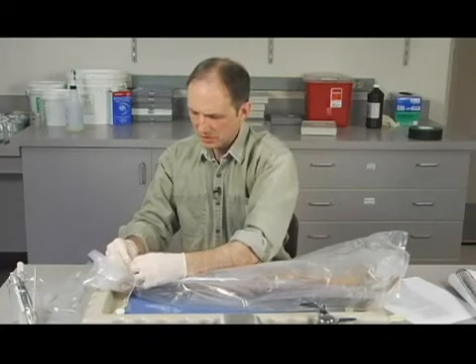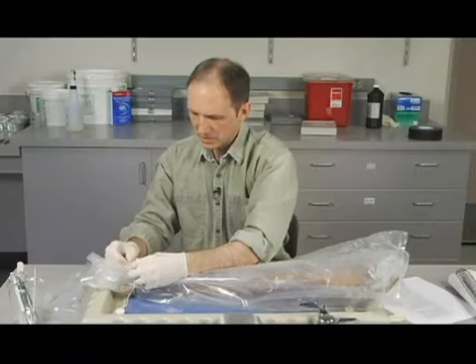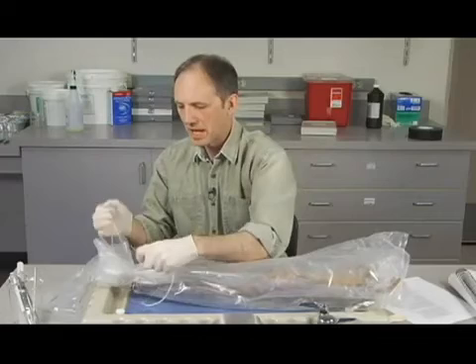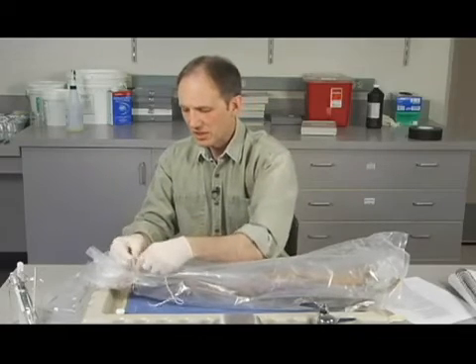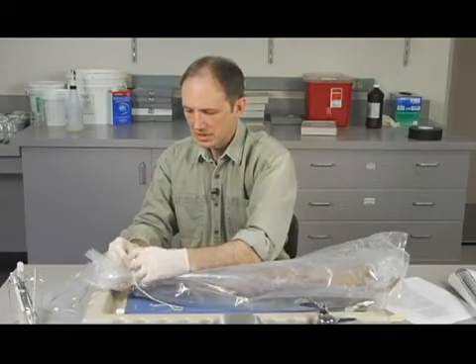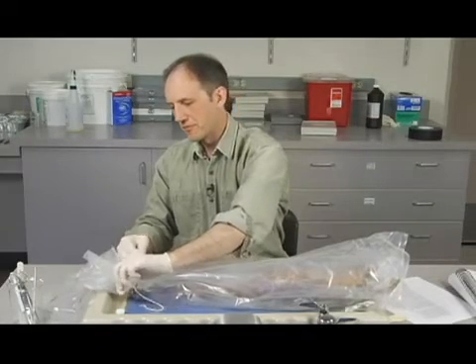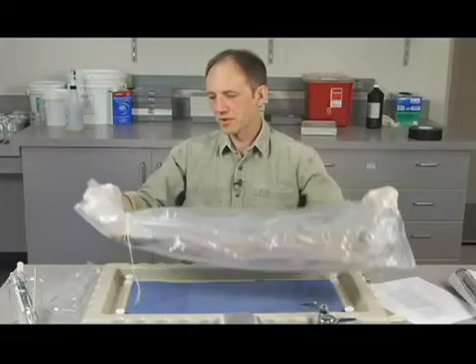That might make it easier for you, whether it's going to be easy for me or not. It might make it easier for you when you try to open the bag back up if you can just untie it rather than cutting it. It's kind of hard to do with the rubber gloves. There we go. That's not real tight or anything like that.